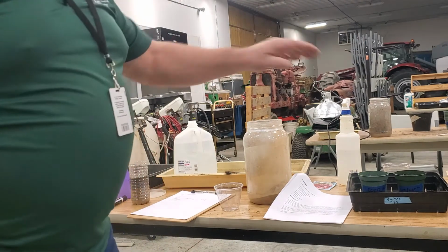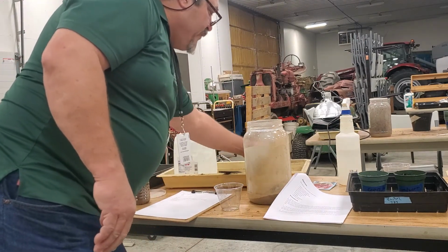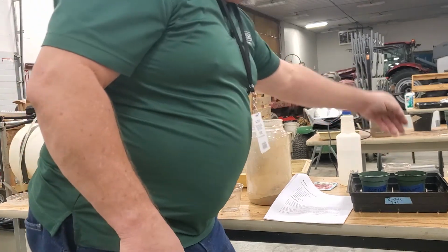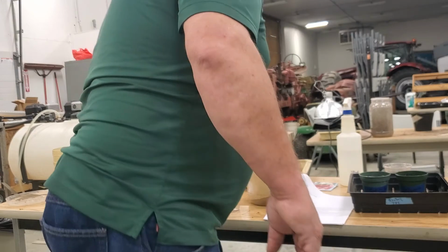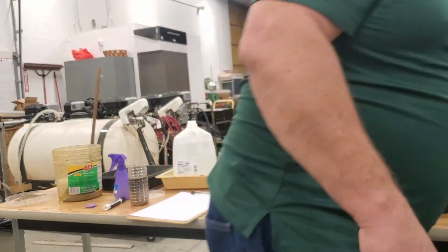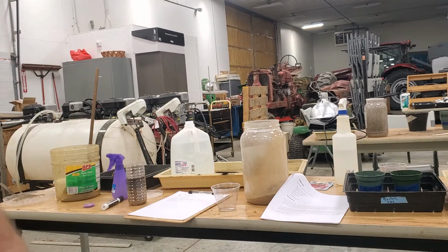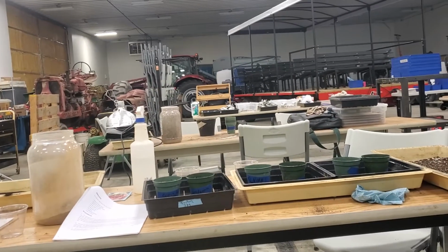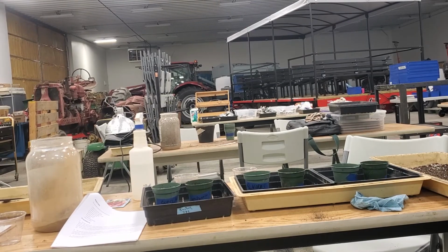So I've put worms in there already, but I'm going to add one more to each so you can see what we did here. So the ones with worms, we put 10 worms in there. We put 10 worms in that one. And we've put 10 worms in that one. So let me come over here and look a little better where you can see everything. So I've got those pots there.